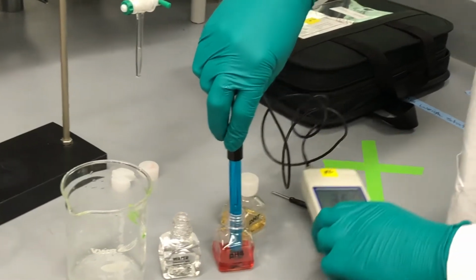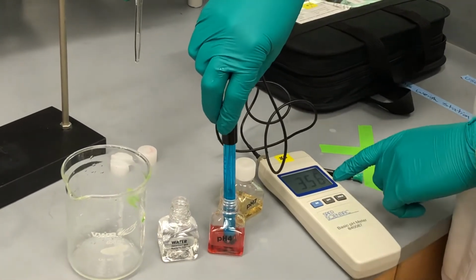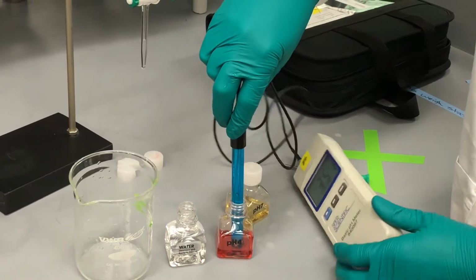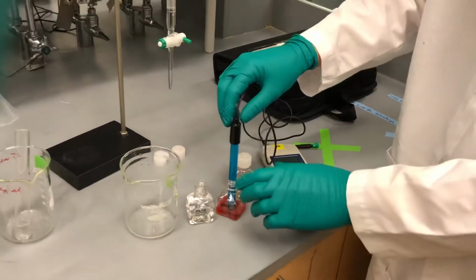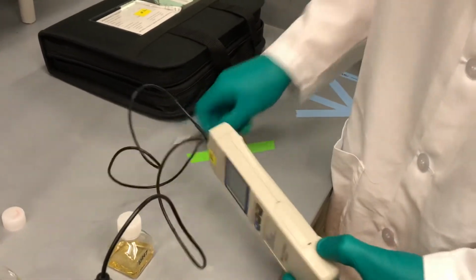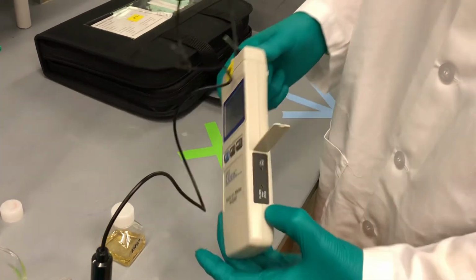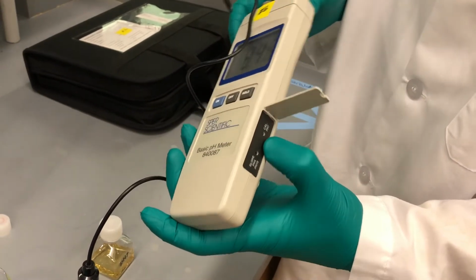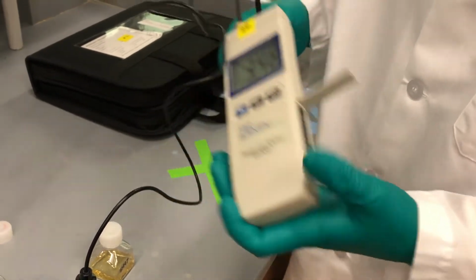So now we are measuring the pH of the buffer solution. But as you can see, the pH probe is not calibrated. That's something that we have to do. So what we're going to do on this right side here, there's a small casing. You can just use a screwdriver to pop it open. And as you'll see here, there are two dials that you can adjust with the flathead screwdriver for pH 4, pH 10, and pH 7 calibration.